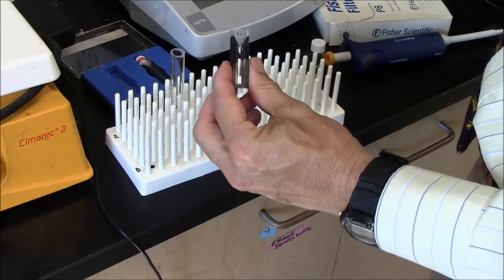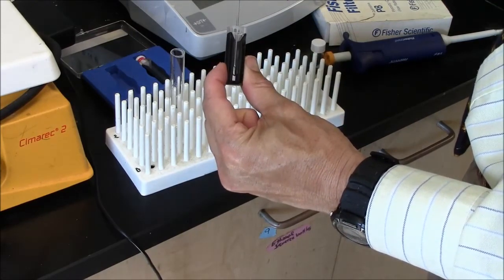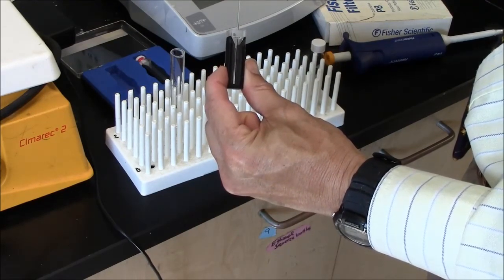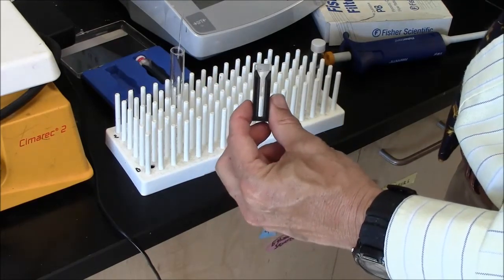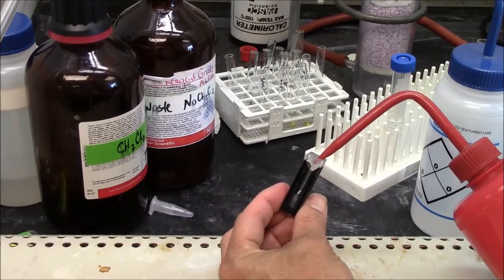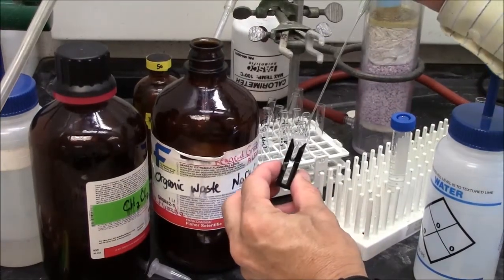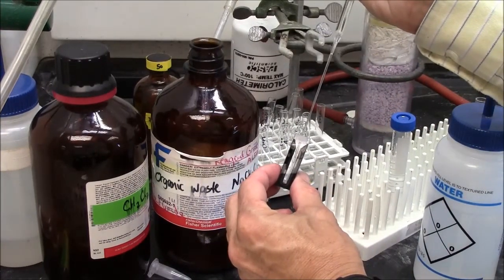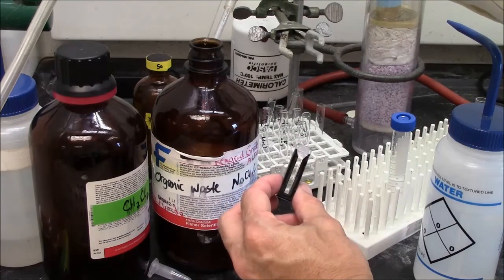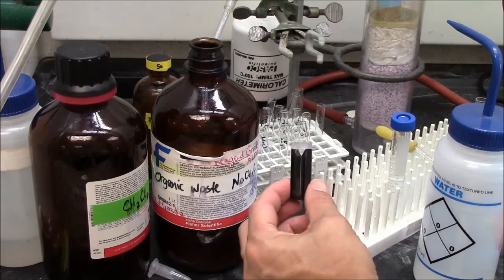I will empty my cuvette using a Pasteur pipette. If I have skill I can pull out 95%, maybe even 98%, of the volume in the cuvette. You need to wash your cuvette. In this case I'm washing with ethanol. I'll pipette this wash ethanol into the organic waste. I may want to repeat this, but this is how you clean a cuvette.